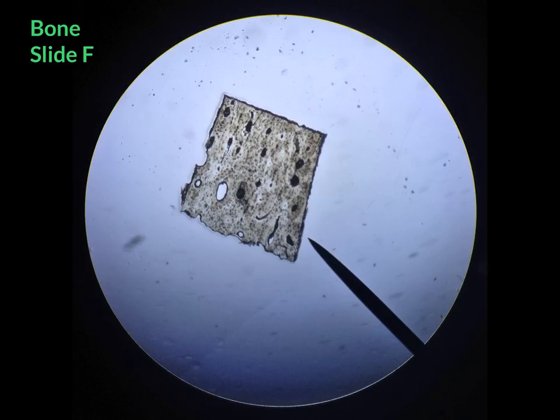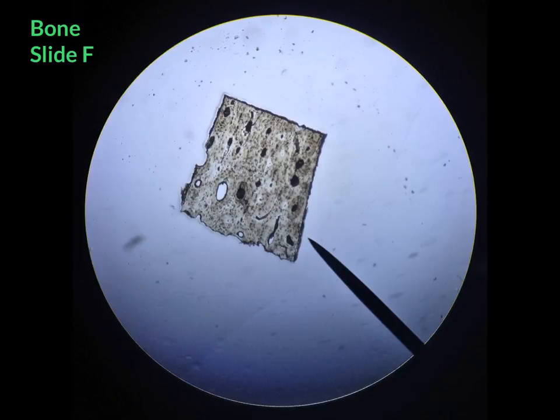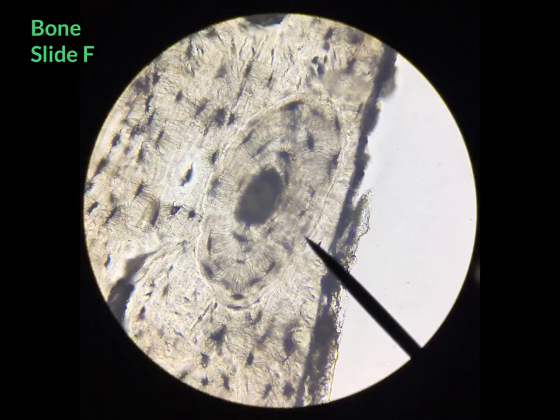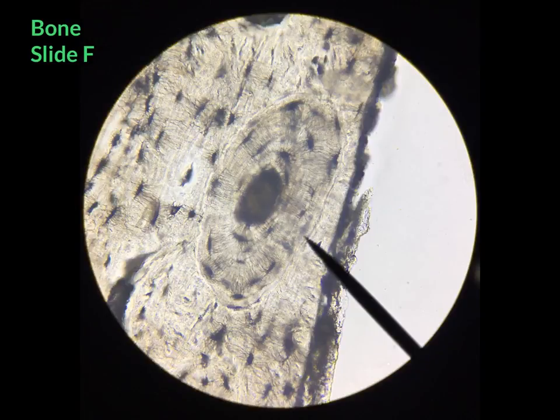The next connective tissue shown here under low power is bone. Bone can be found on slide F. Taking a closer look at bone under high power, you can see the many different structures of bone.